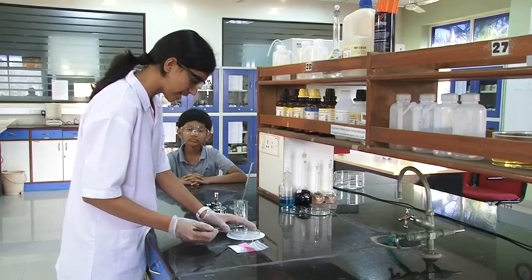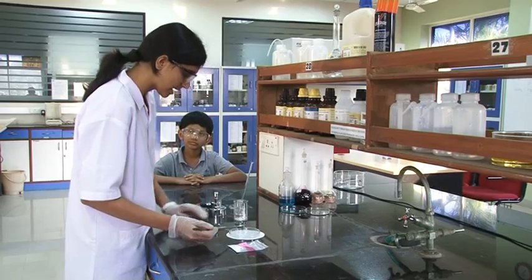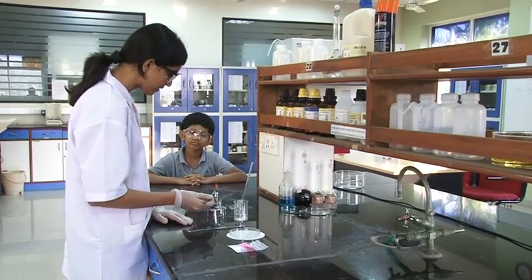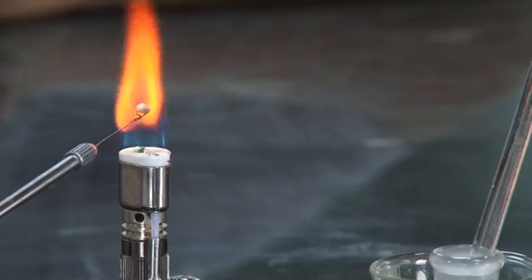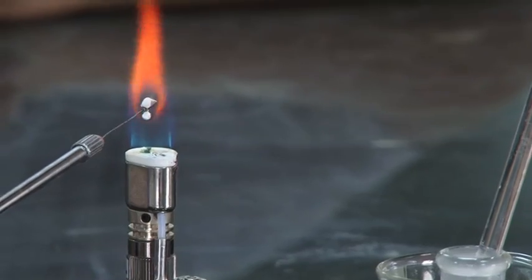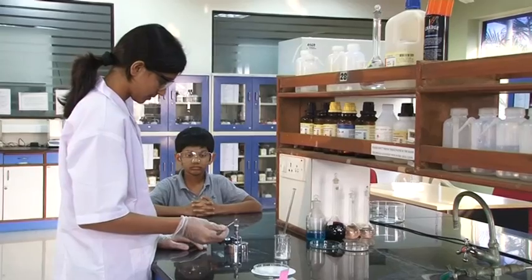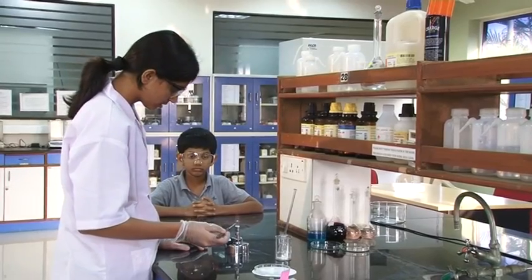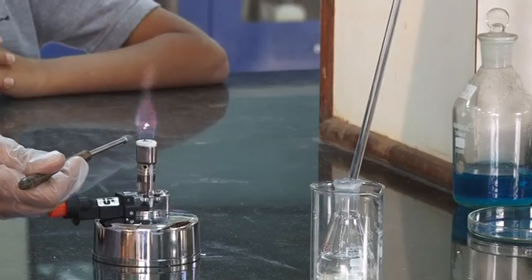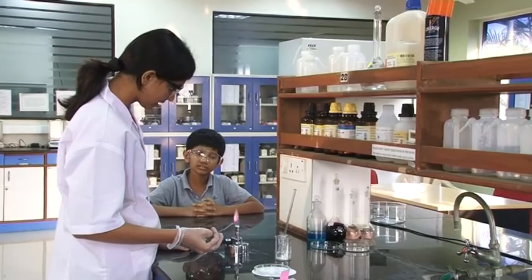Vivek, this is calcium chloride. We have a paste of calcium chloride and HCl, and now we'll show it to the flame. It's brick red. Yes, that's typical of calcium.